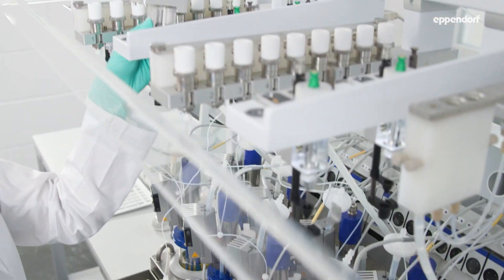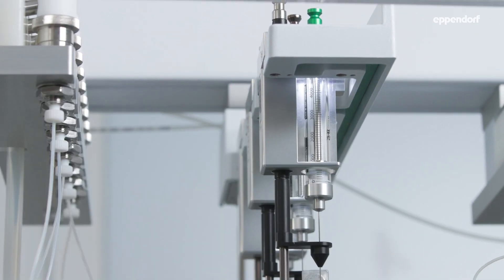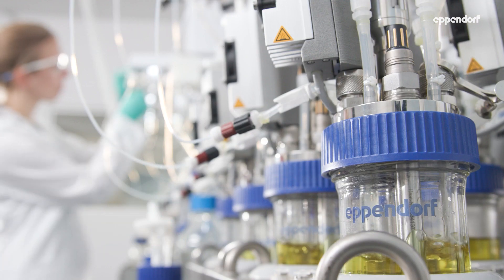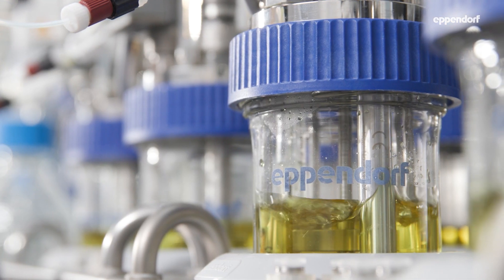The Eppendorf AutoSampler will help to reduce development times while increasing traceability as well as consistency. This will lead to reduced development costs, faster transfer to production, as well as shorter time to market.